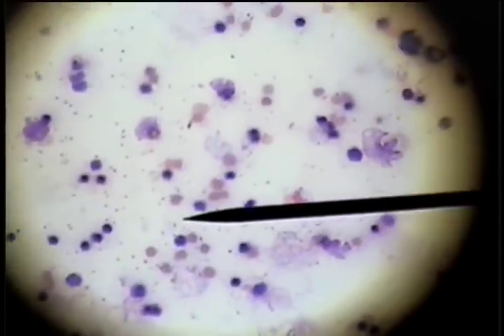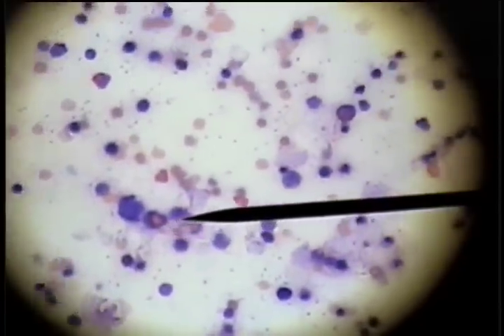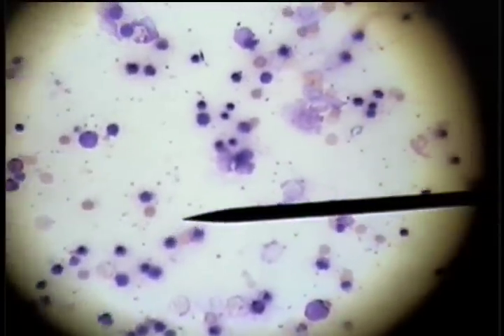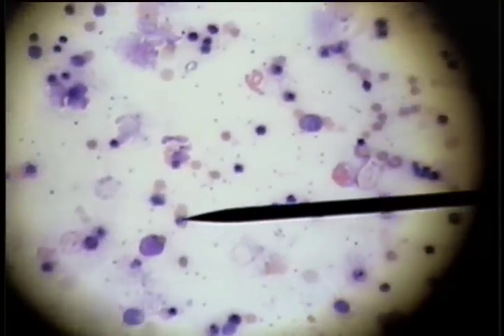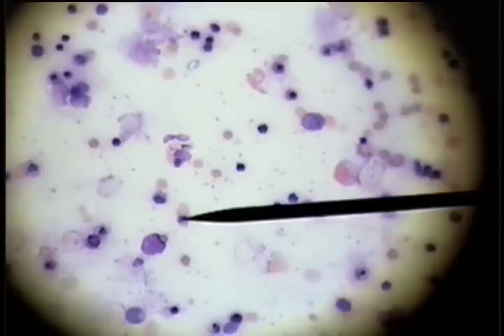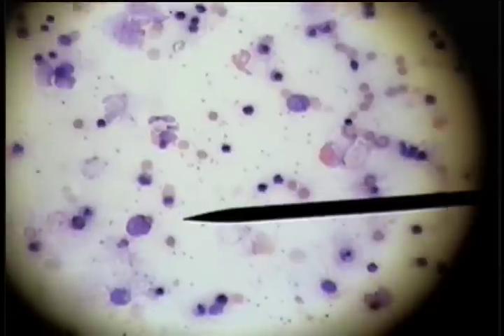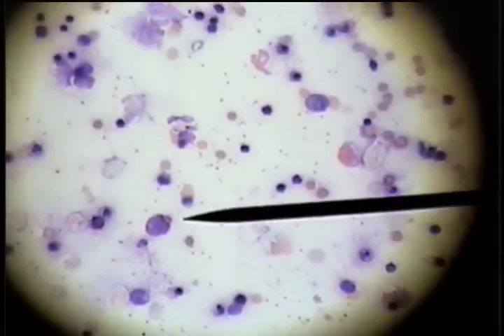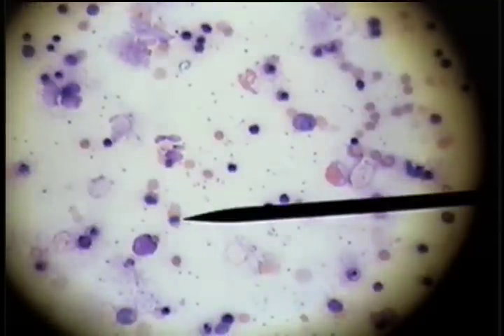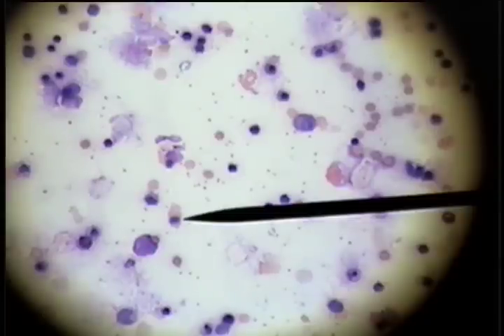What we do know is we can recognize these red cells just before they extrude their nucleus, because that's the last stage of development of the red cell before it's released into the bloodstream. Here's a red cell that is just ready to release its nucleus and become a mature erythrocyte. This cell that is just about to release its nucleus is called an orthochromatic erythroblast — we'll settle for the name normoblast, a maturing red cell.